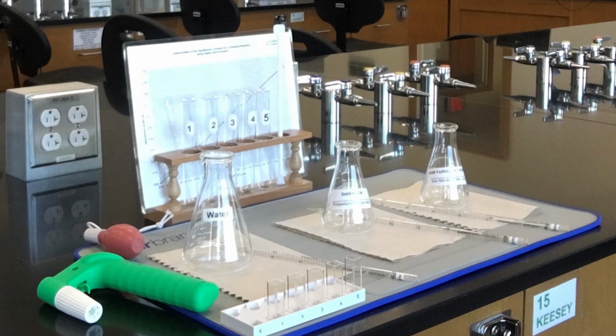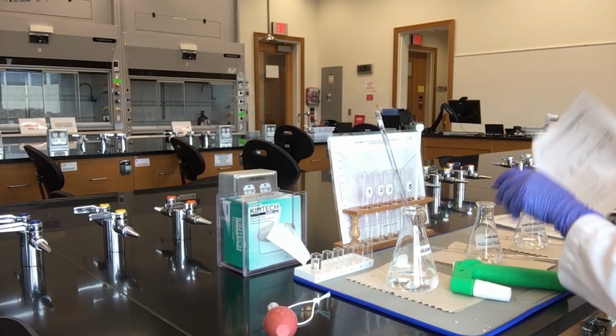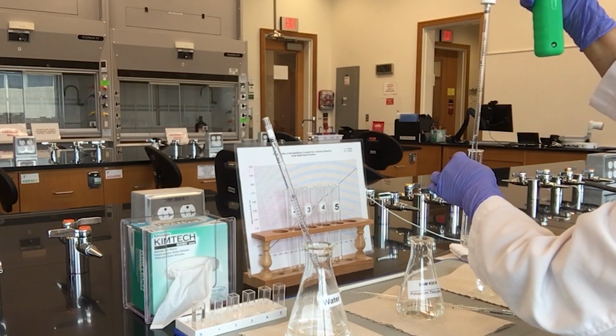Label 5 medium test tubes 1 to 5 on your test tube rack. And from the reagent cart, obtain 5 cuvettes and label them on the cuvette holder. You will also need a calibration curve to find the equilibrium concentrations of all of the species to complete Table 2 of your data and calculations. With Table 1 of your data and calculation sheet as your guide, measure out exactly the volume of each reagent as written on the table.